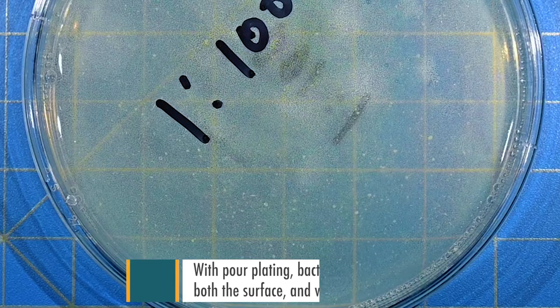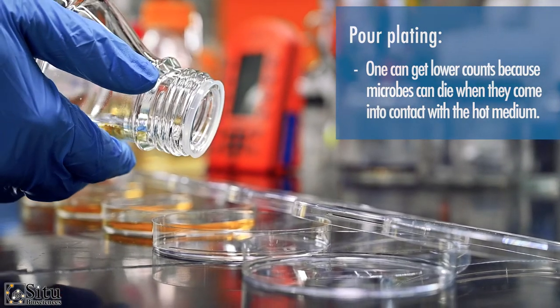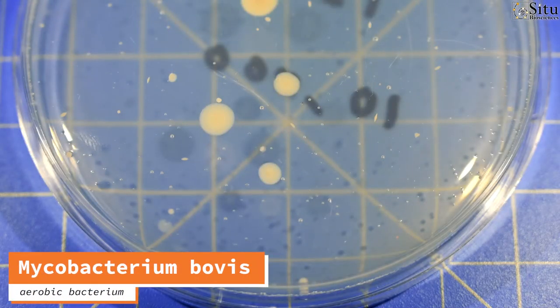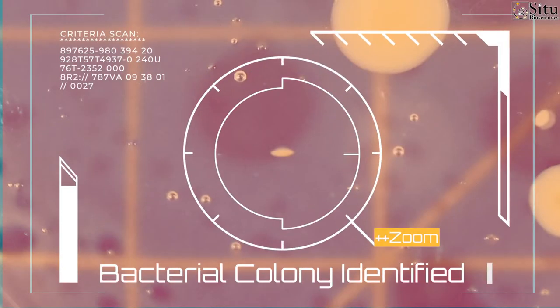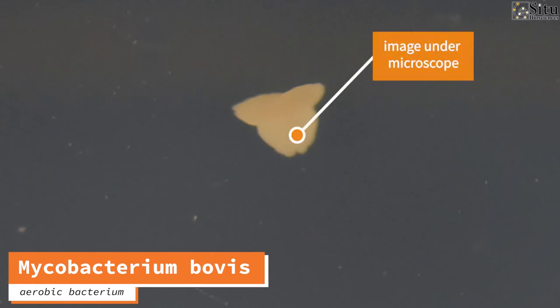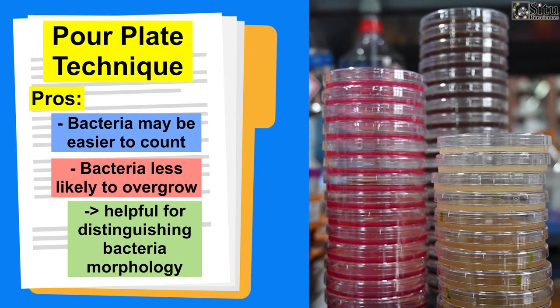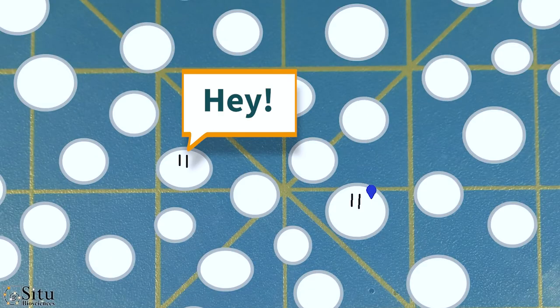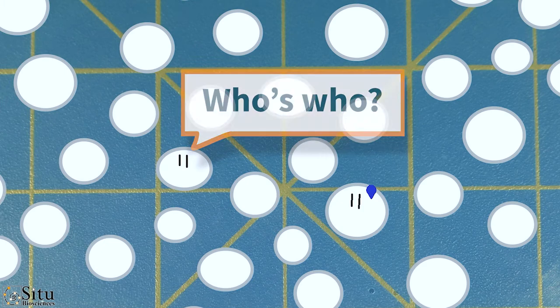However, with pour plating, one can get lower counts because microbes can die when they come into contact with the hot medium. Benefits of this method include more precision by virtue of the bacteria growing in the agar — they're smaller, which makes it easier on the eyes to count. Additionally, they don't overgrow, which means colonies don't end up in such close proximity that they merge, which is helpful in being able to distinguish certain details.